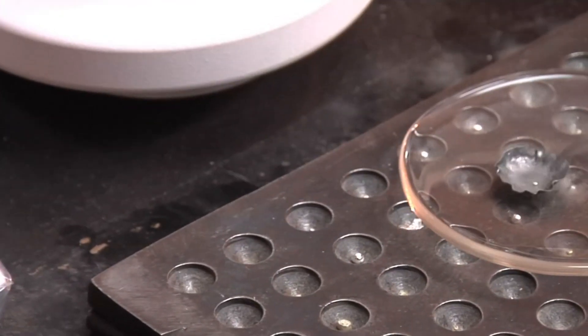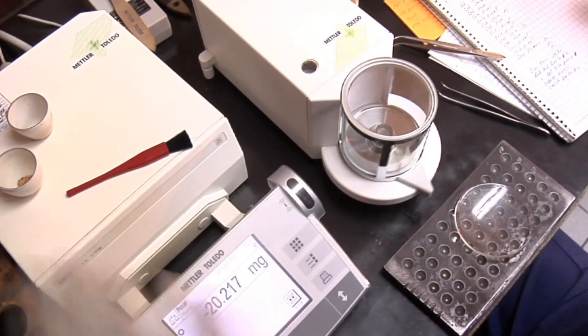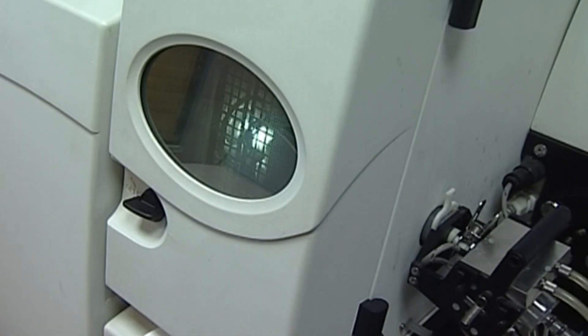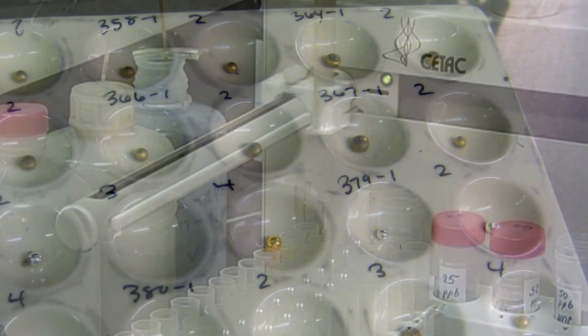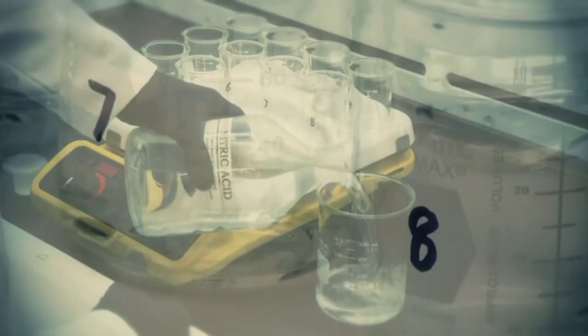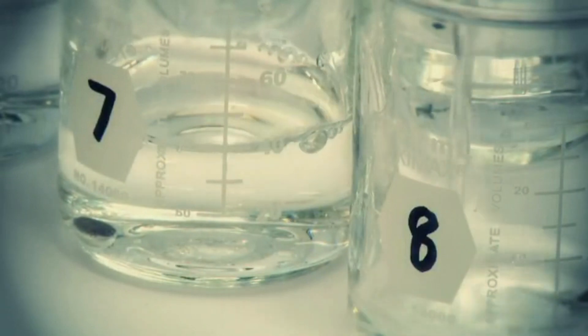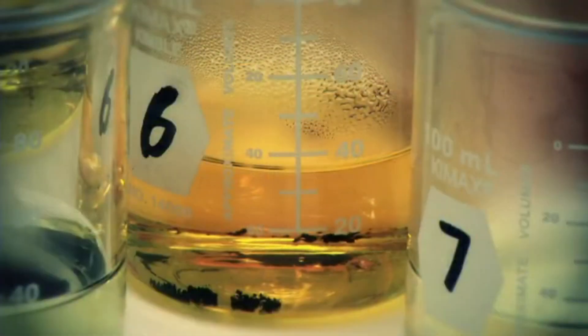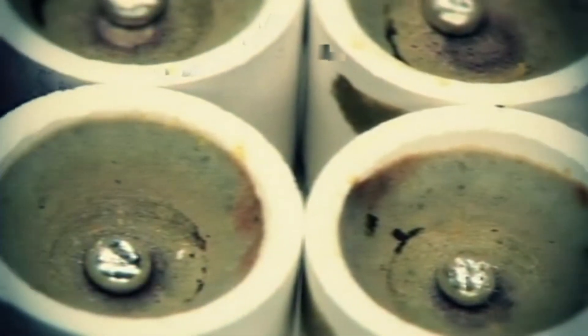The bead is then weighed and analyzed further for precious metal content using an instrumental analysis technique such as ICP-AES. When silver is present in a gold-bearing sample, the bead can be further analyzed by parting, or dissolving away the silver content in nitric acid solution, leaving the gold. Concentrations can then be calculated by the weight ratios. Low concentration samples will produce very small beads, so silver is sometimes added in the fire assay process as a way of obtaining a larger metal bead, which improves accuracy of results.